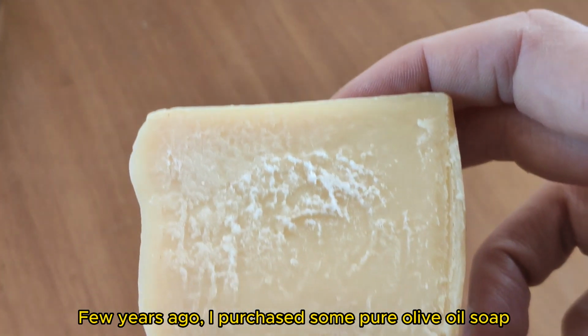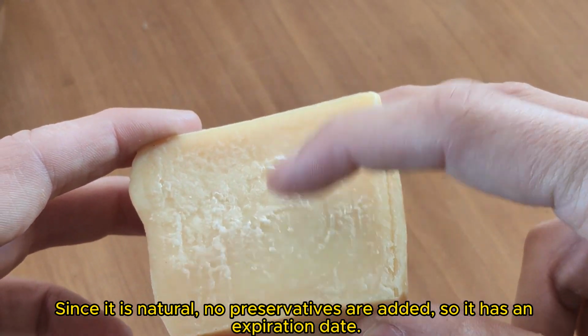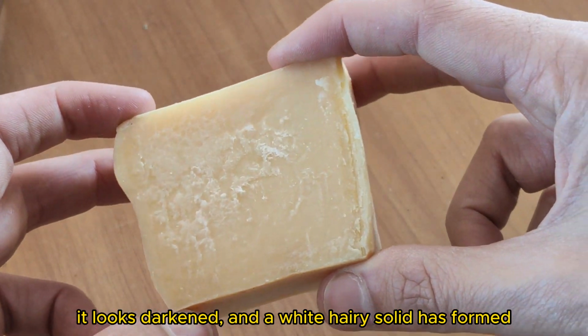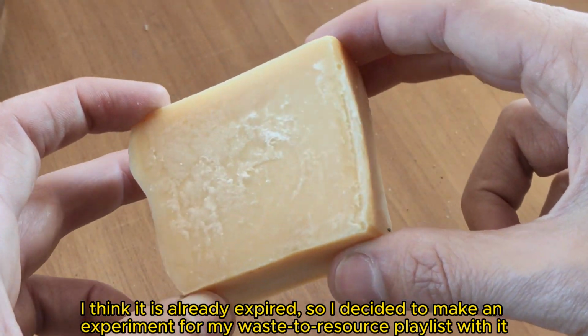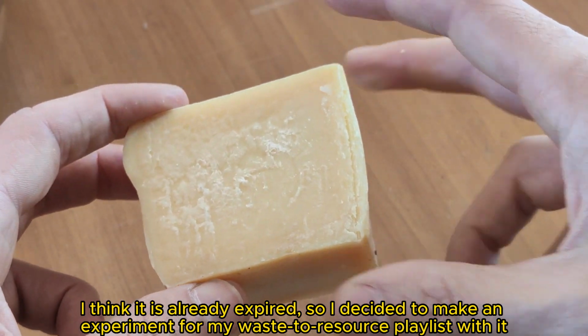A few years ago, I purchased some pure olive oil soap. Since it is natural, no preservatives are added, so it has an expiration date. It looks darkened, and a white hairy solid has formed. I think it is already expired, so I decided to make an experiment for my waste to resource playlist with it.